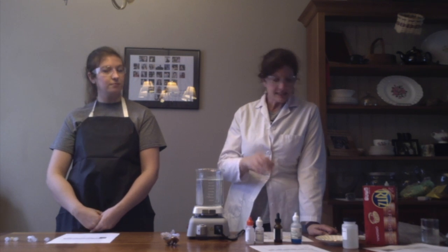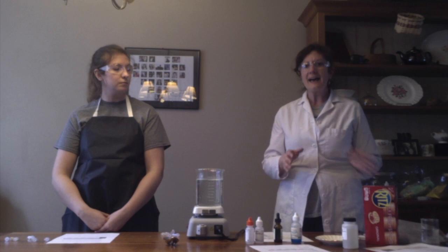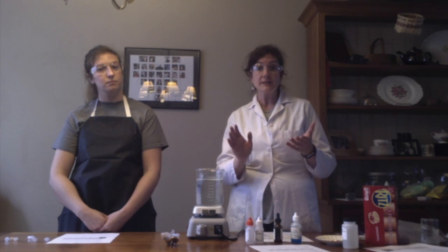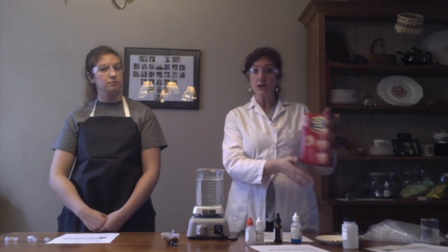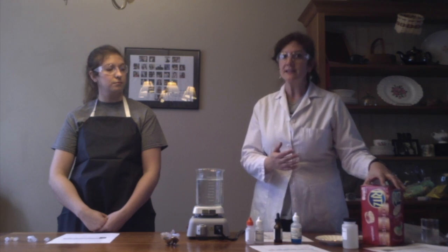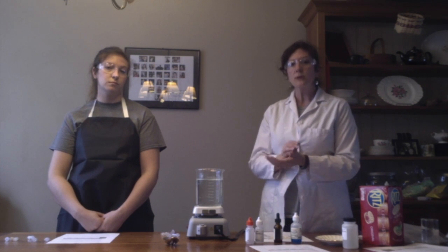We're going to be using indicators today. The question we're trying to investigate is what's happening when starch gets broken down. So you may have heard of a food being starchy, right? Crackers are a great example. Pasta. You may have heard of potatoes being starchy. So we're going to take a look at what happens when starch breaks down.